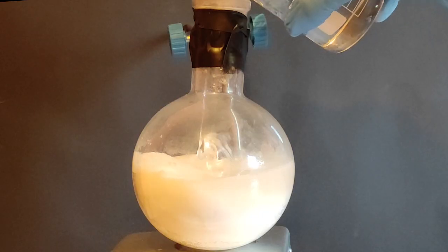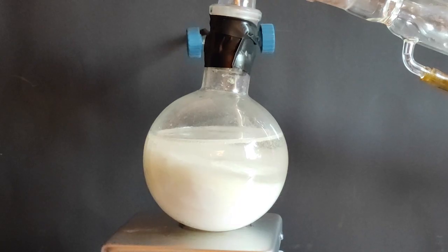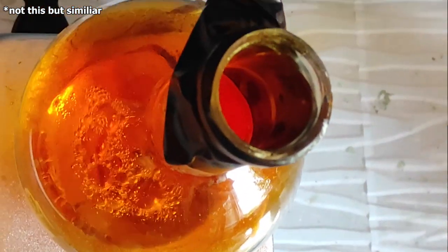Please don't laugh. When you're ready, add all your sulfuric acid to the flask. First, not much will happen, but after you heat it up, you will see blood red fumes emerging from flask.